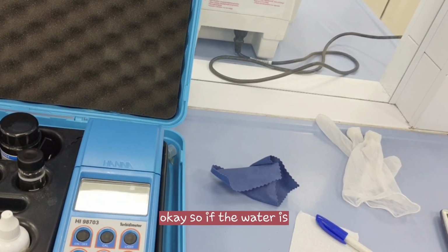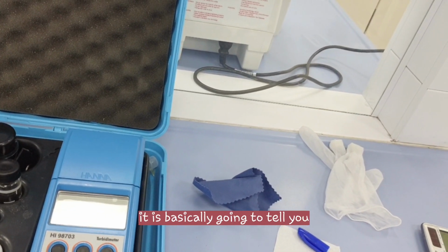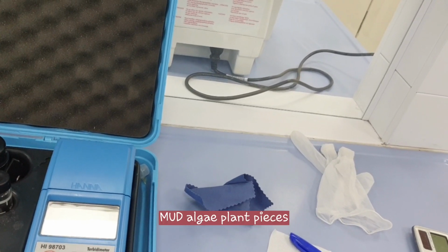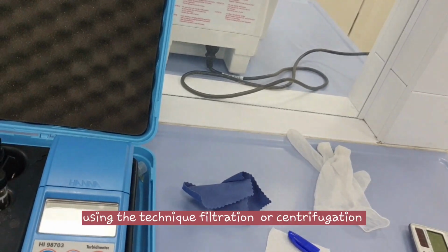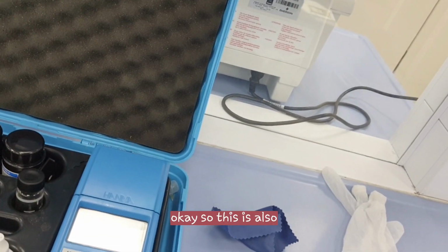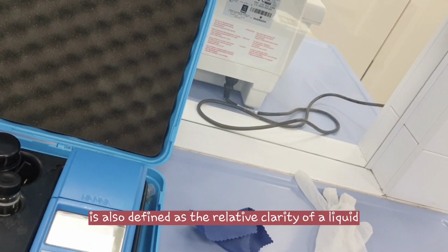If the water has a high turbidity, it can be caused by silt, mud, algae, plant pieces, melting glaciers, sawdust. Normally water with a high turbidity needs to be cleared using techniques like filtration or centrifugation.